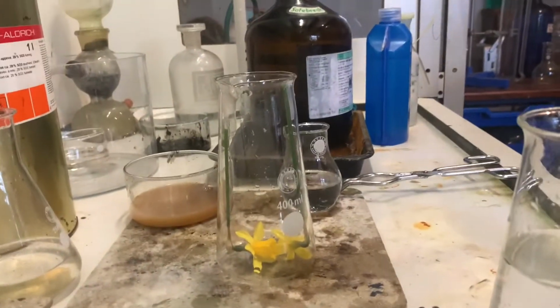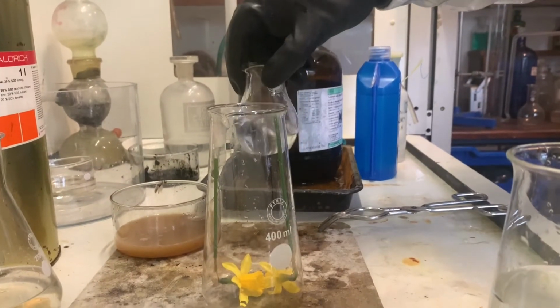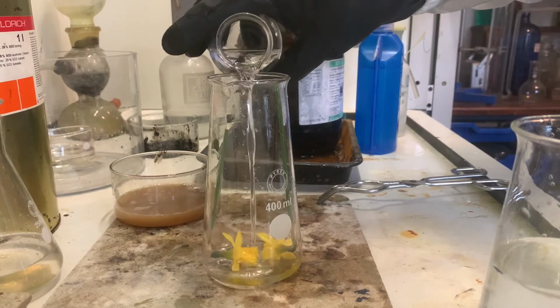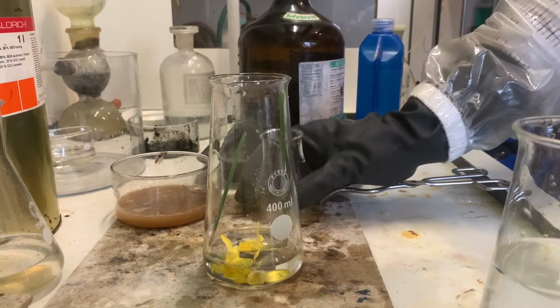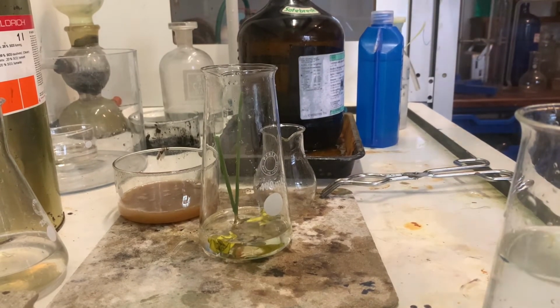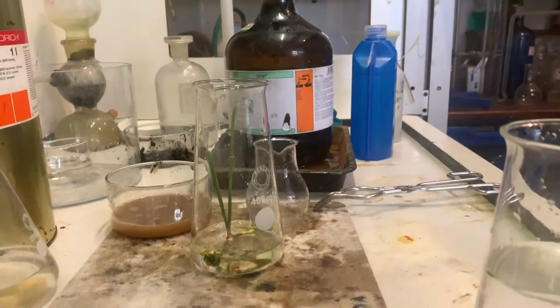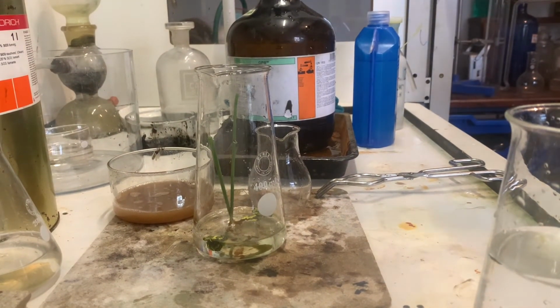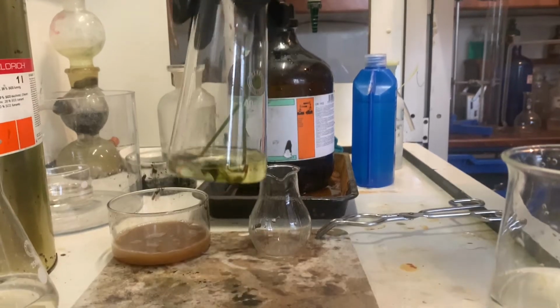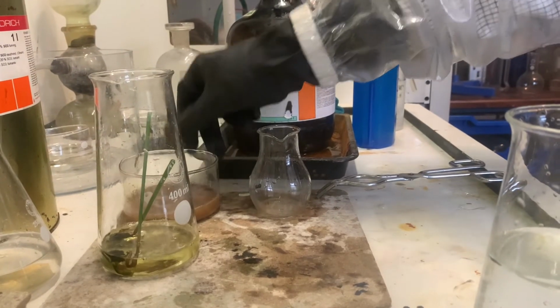And it's very important to label concentrated sulfuric acid, because quite literally, it looks like water. And of course, if you left that lying about, somebody could very stupidly drink it. And this is what would happen to their insides if they drunk it. And unfortunately, in life, many people have, in the 1940s and 50s, whenever labelling wasn't as good as it is today, whenever specific poisons were labelled corrosive, they would have seen the word poison or toxic, and wanting to do away with themselves, they'd have drunken that thinking it would have poisoned them, when in fact all it did was burn their insides out. And you can see those daffodils in a matter of seconds are just dissolving, and if we leave them in long enough, exactly the same thing will happen to the meat.